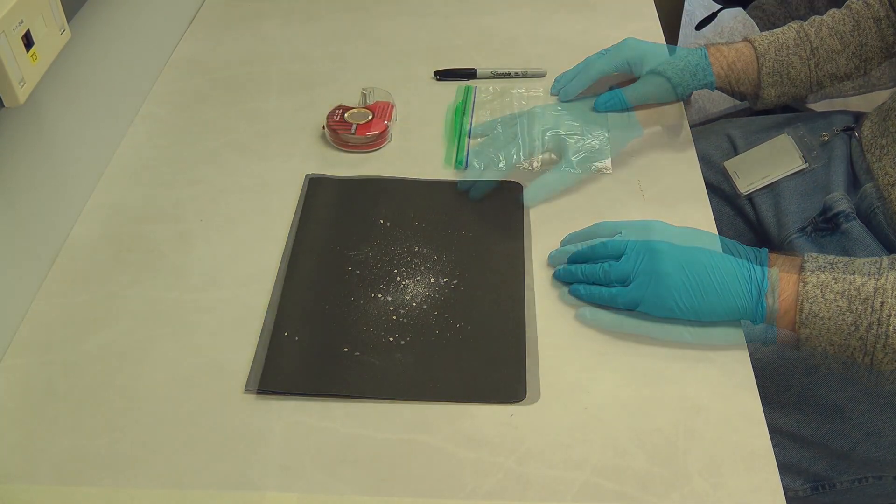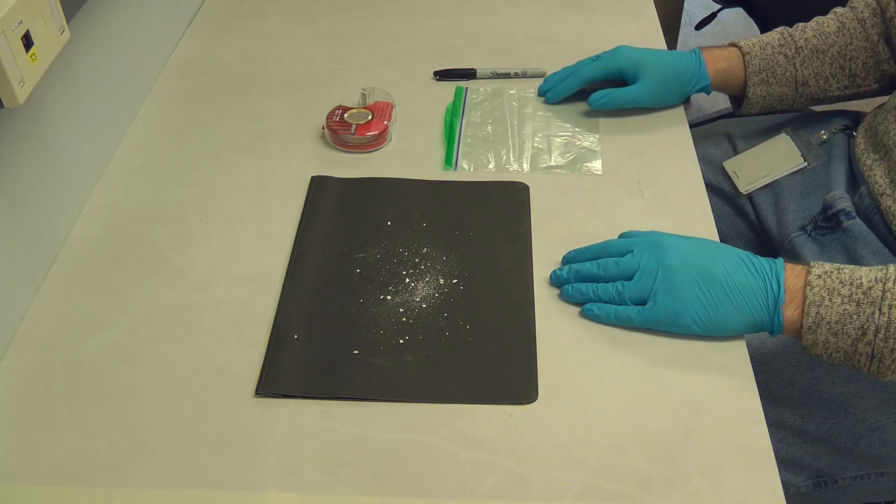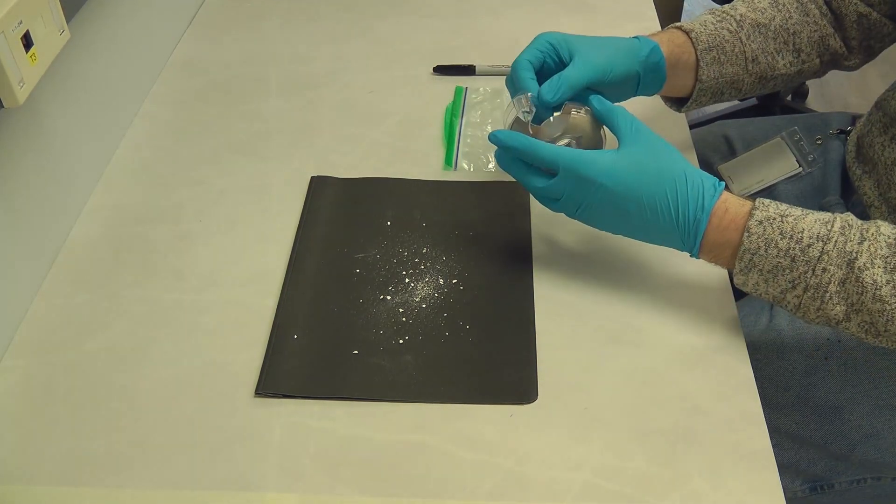Next select the spot where you want to take the sample from. This can be a window, bookshelf, or any other surface of concern which may have dust.